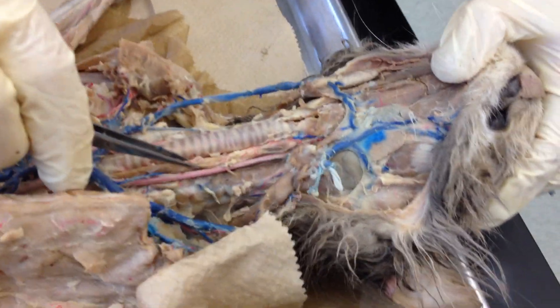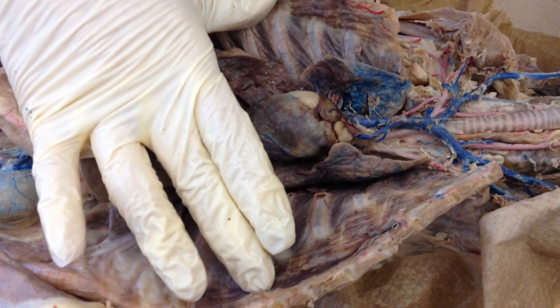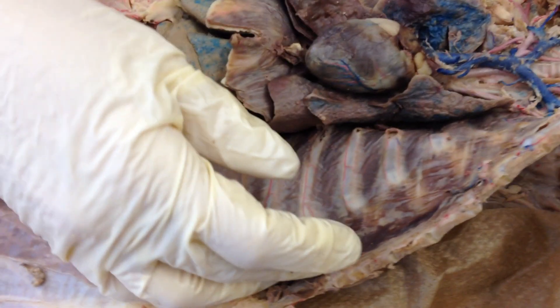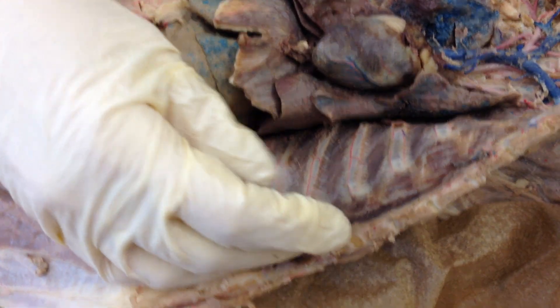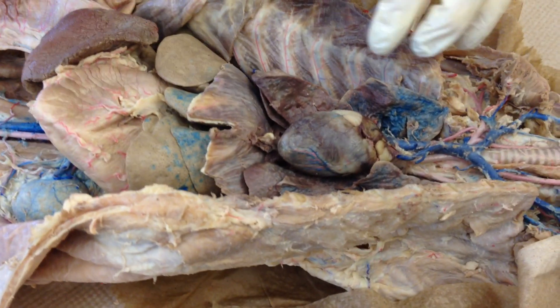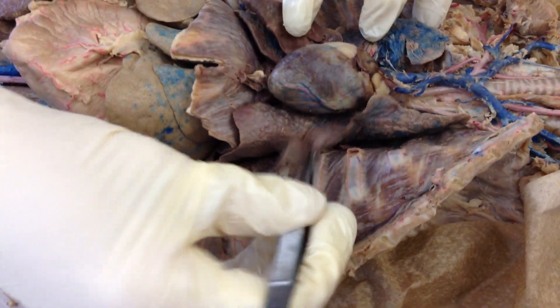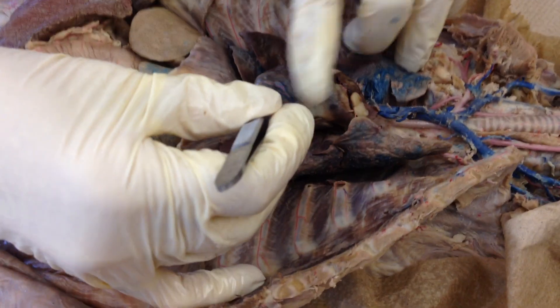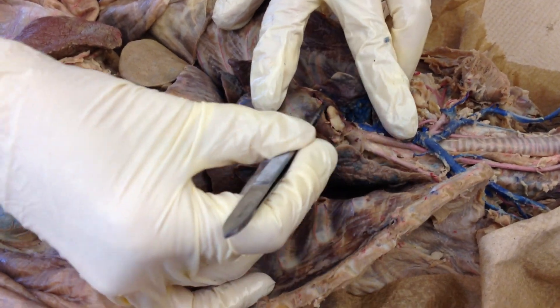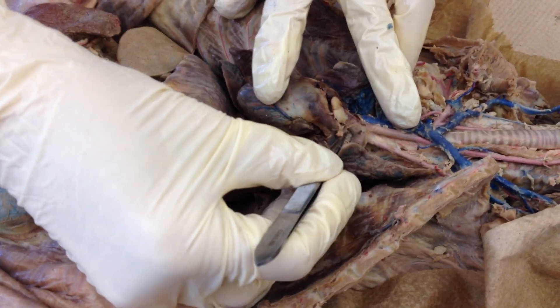Here you can see the trachea, and there's the esophagus. Let's come here to the heart. If you're looking at the thoracic region, here's your lungs, here's your heart. This is the pulmonary trunk, and here's the aorta.